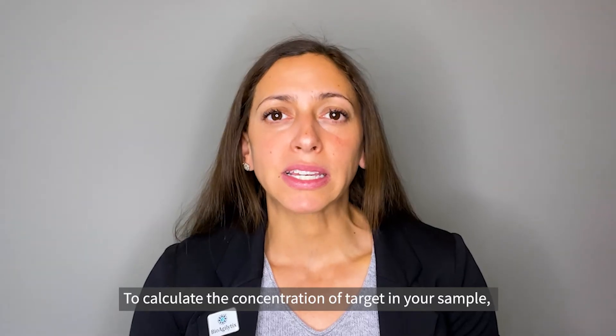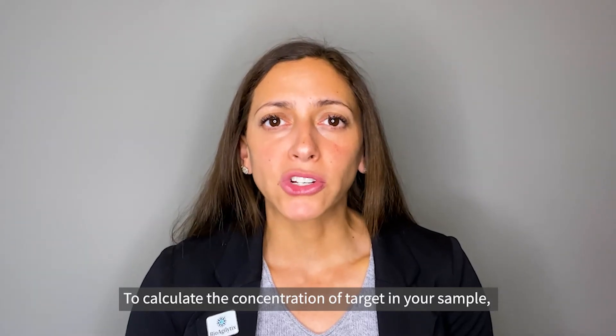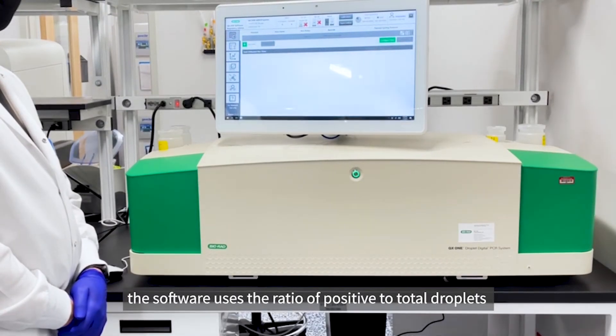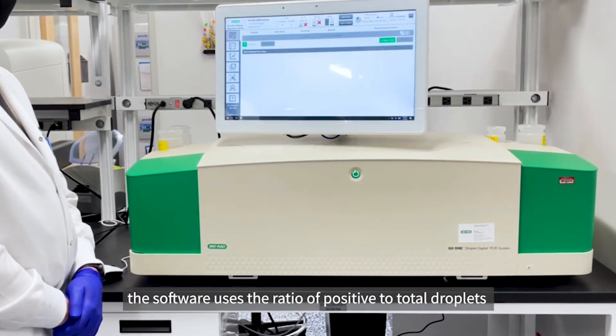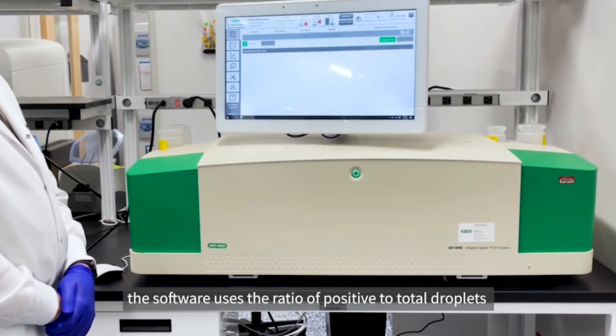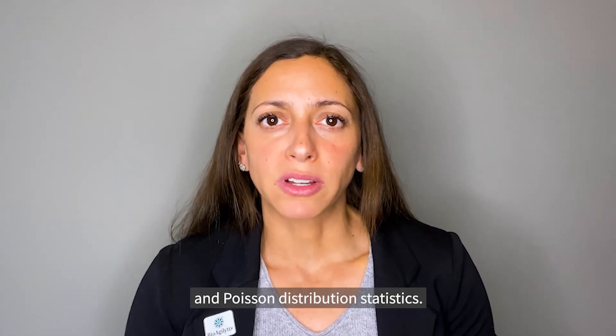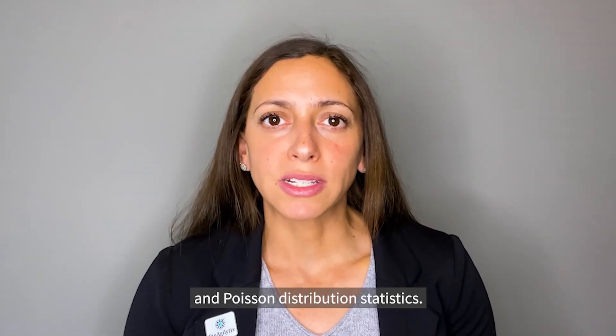To calculate the concentration of target in your sample, the software uses the ratio of positive to total droplets and Poisson distribution statistics.